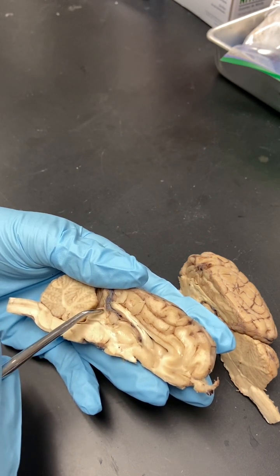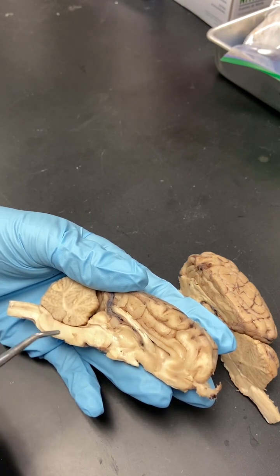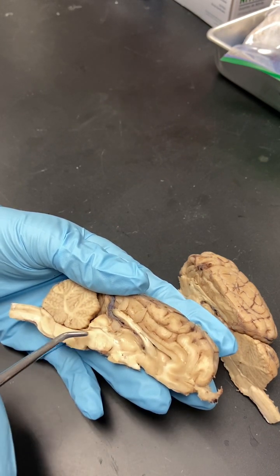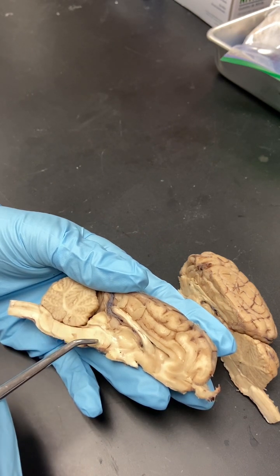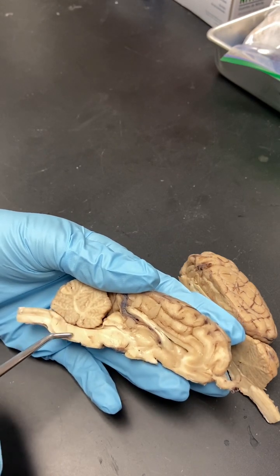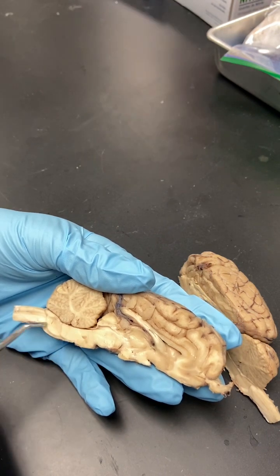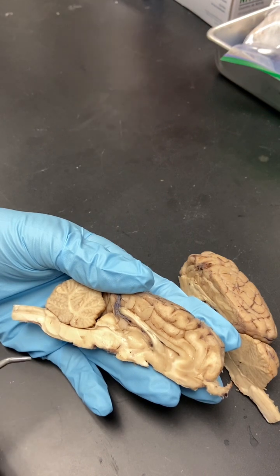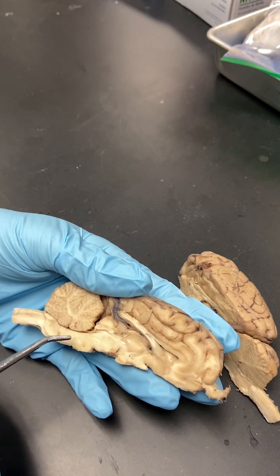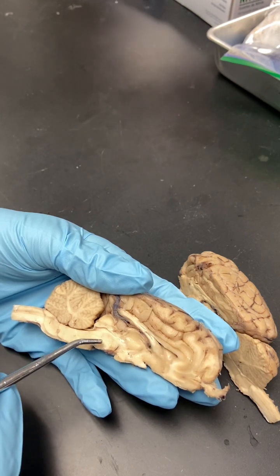Here you have the superior colliculi and inferior colliculi. These are up against the cerebellum, and they play a role in connecting motor functions with the cerebrum because they're up against it. Below the inferior colliculi, you have the midbrain, you have the pons, and then you have the medulla oblongata. If you're not able to clearly see those, that's okay. Just make sure you know the correct order, and I'll make it very clear when I ask on the test for that. And these all are involuntary. They have to do with the primal things like blood pressure and heart rate, breathing, things like that.